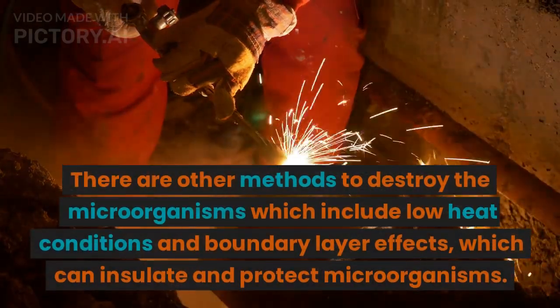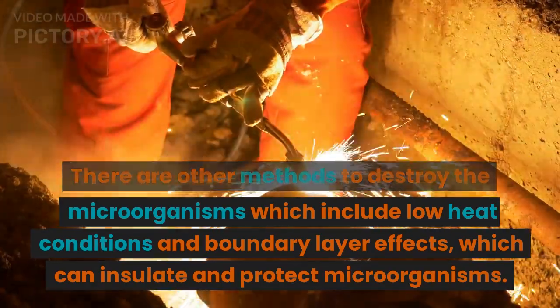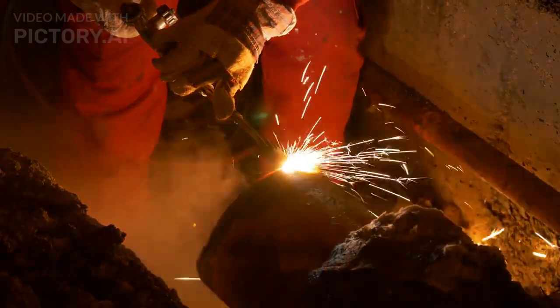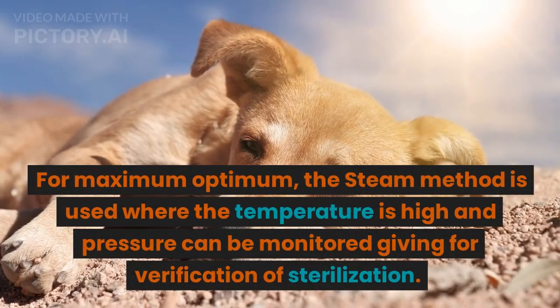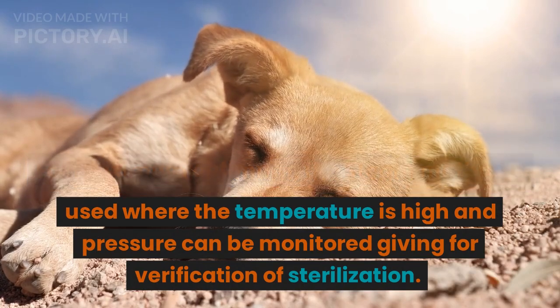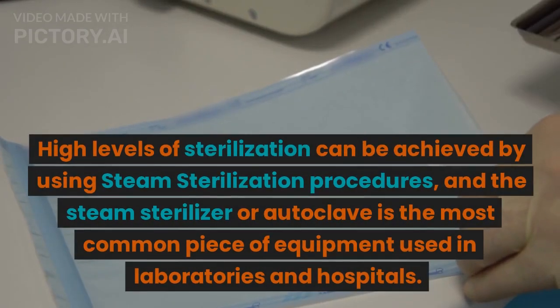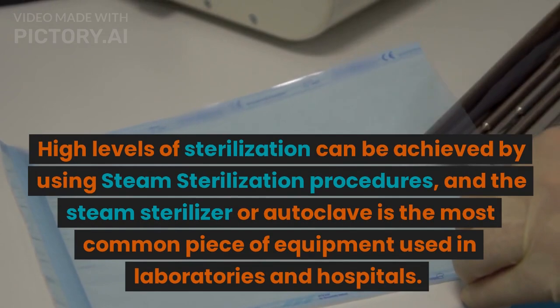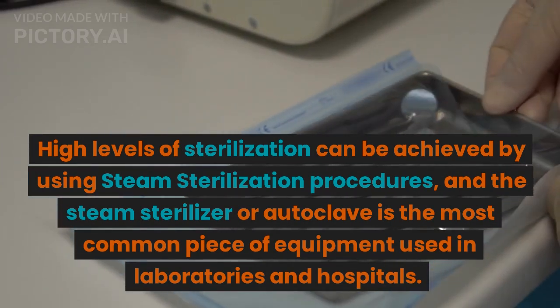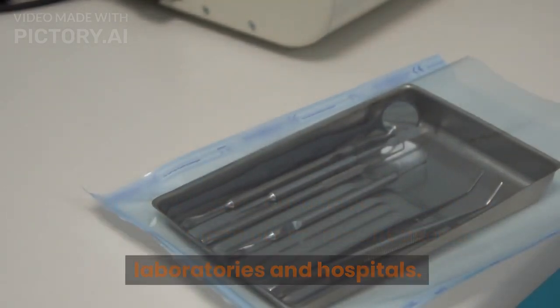There are other methods to destroy microorganisms, which include low heat conditions and boundary layer effects, which can insulate and protect microorganisms. For maximum efficacy, the steam method is used where the temperature is high and pressure can be monitored, allowing for verification of sterilization. High levels of sterilization can be achieved using steam sterilization procedures, and the autoclave is the most common piece of equipment used in laboratories and hospitals.